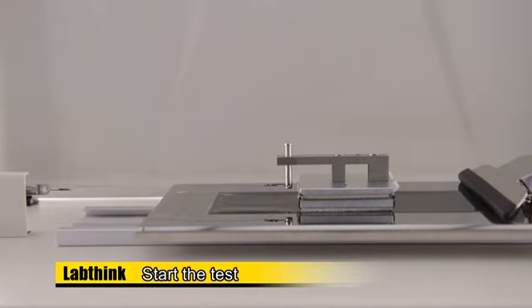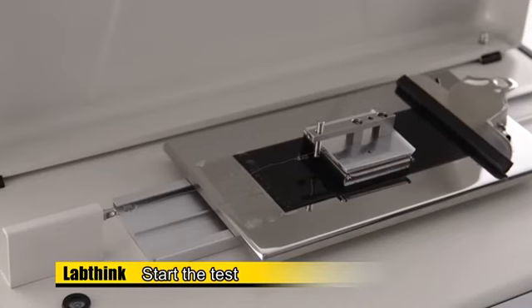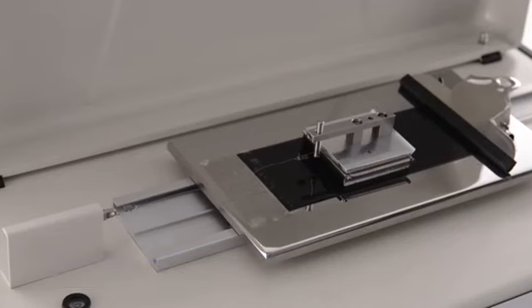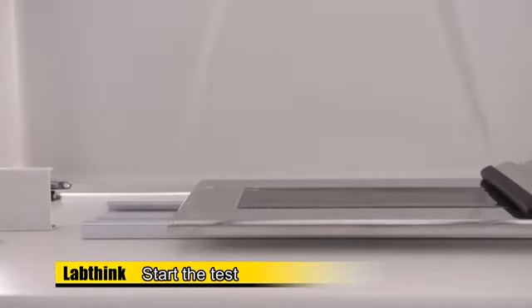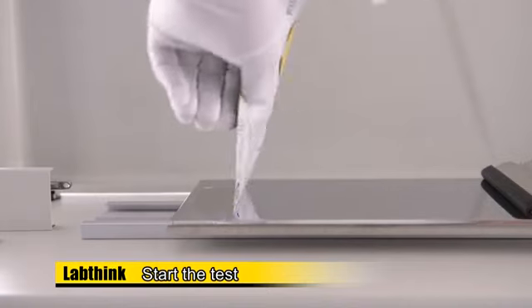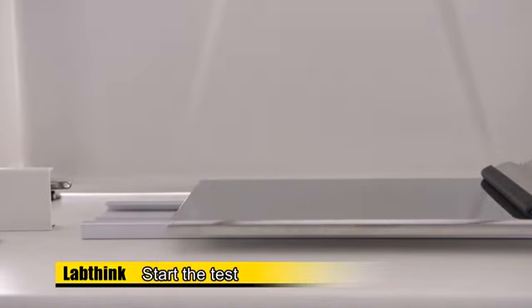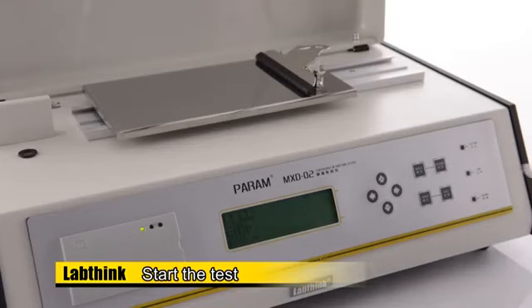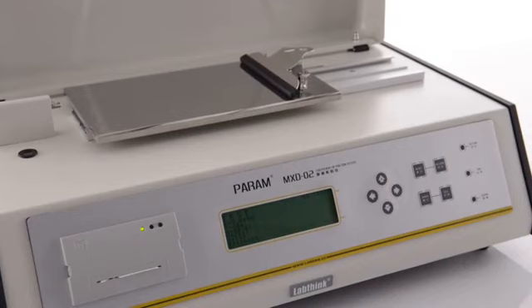When the time reaches 42 seconds, the test will be finished. When the test is finished, please remove the steel wire and the sled. Press Return so that the test platform will be returned to its original position, and when the indicator light on the right side of the instrument is on, it will stop.